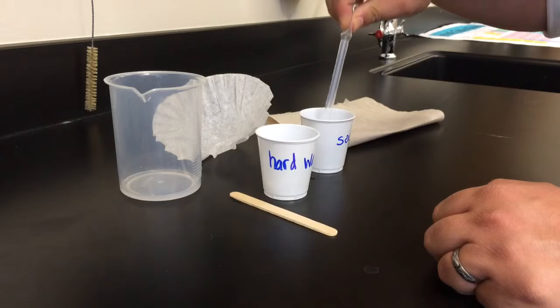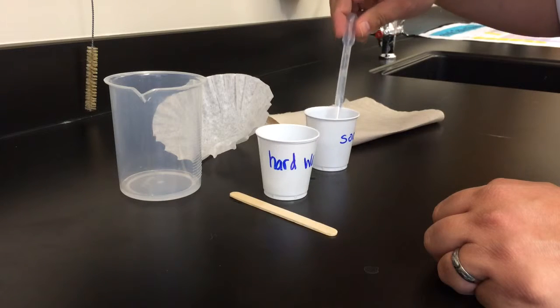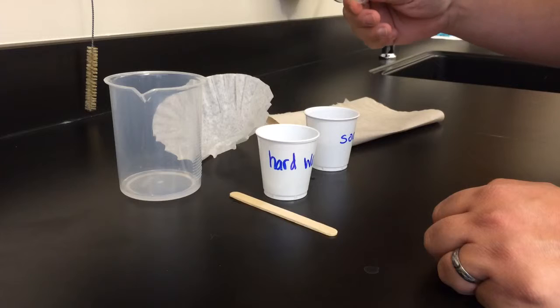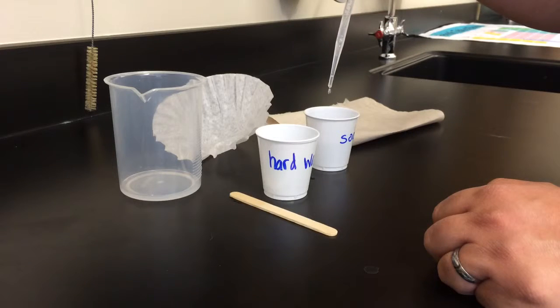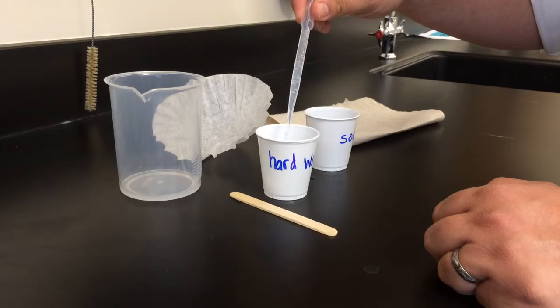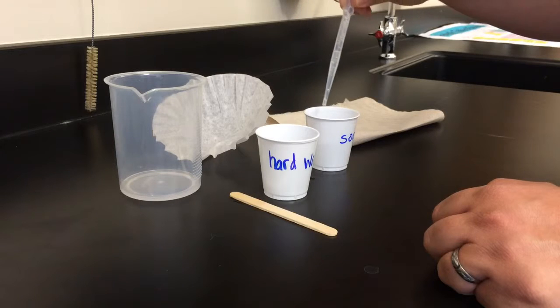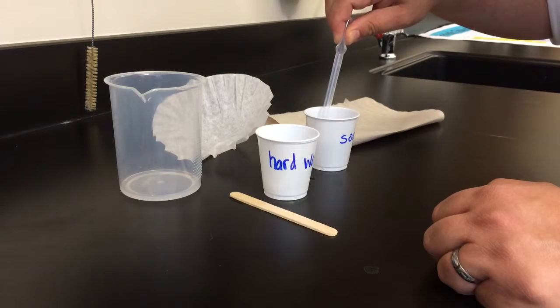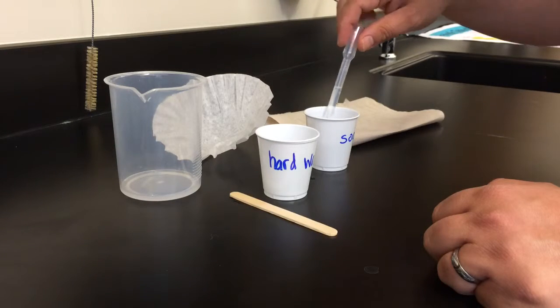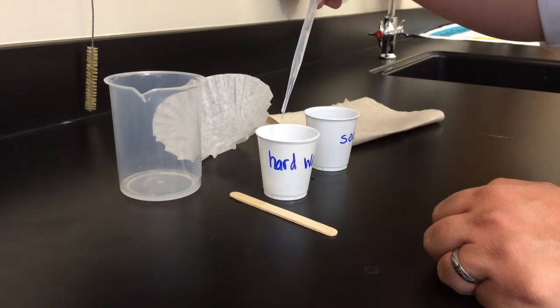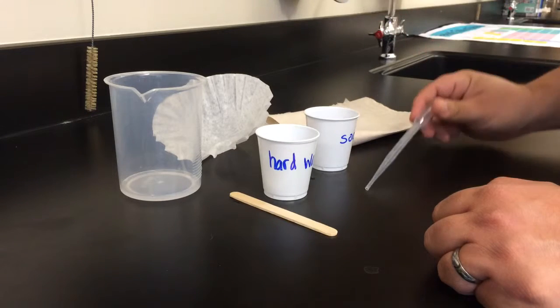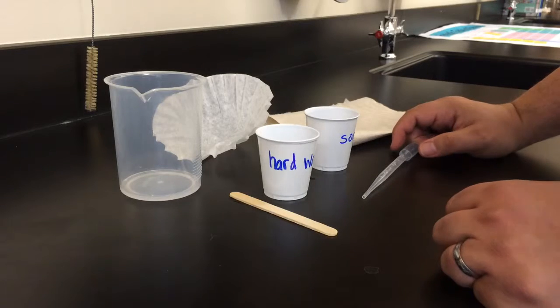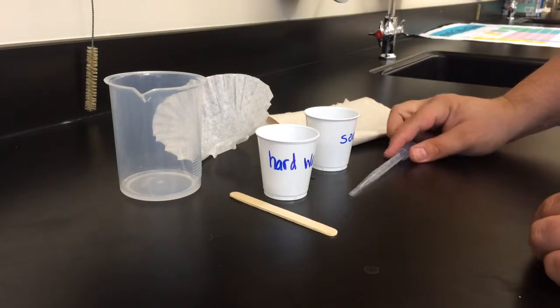So let me drop one or two more, see there I got a big piece of soap that I don't want so I'm gonna make sure when I add it in here that it doesn't go in because my job, my challenge that Mr. C has given me, is to prove that the stuff that I'm making is not soap and so the easiest way to do that is to make sure that there's no soap going in there.